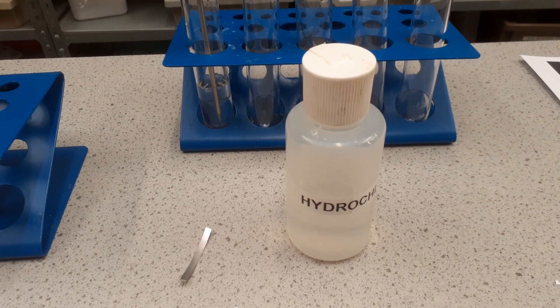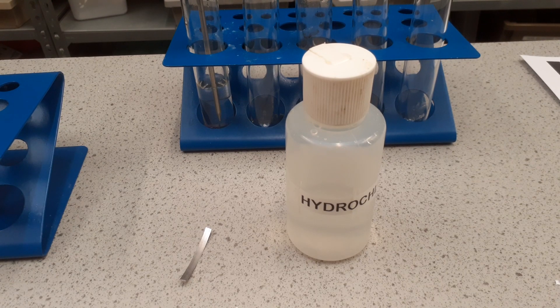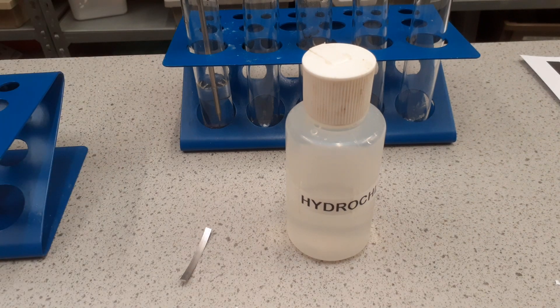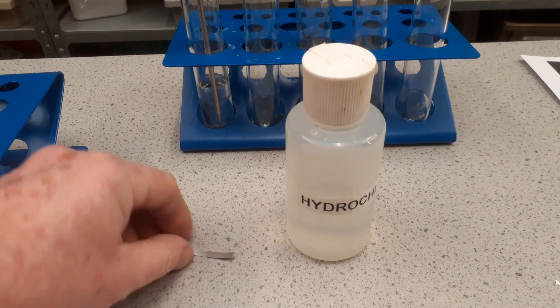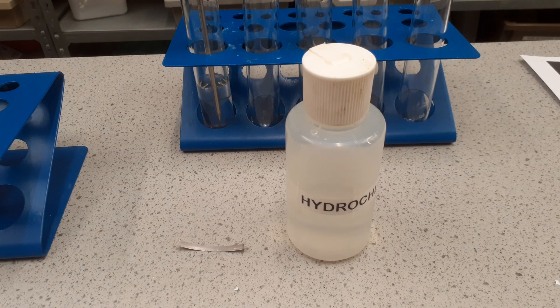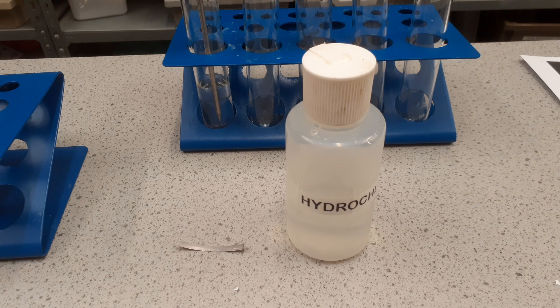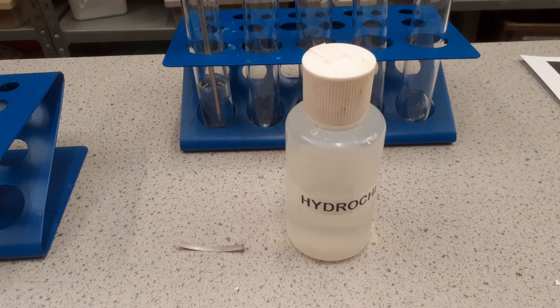Here's our first experiment. We're looking at hydrochloric acid and magnesium. In here I put 15 centimetre cubed of hydrochloric acid. Here is my piece of magnesium. To get our start temperature, which we're measuring using a digital thermometer, it's 18.1 degrees C.